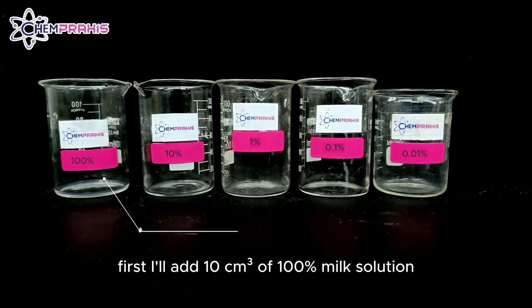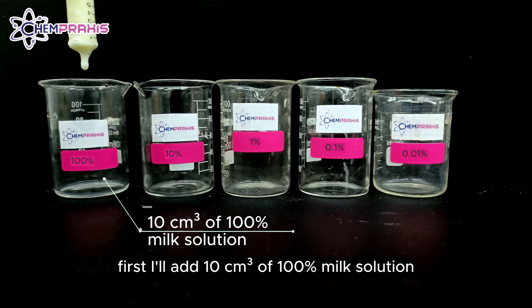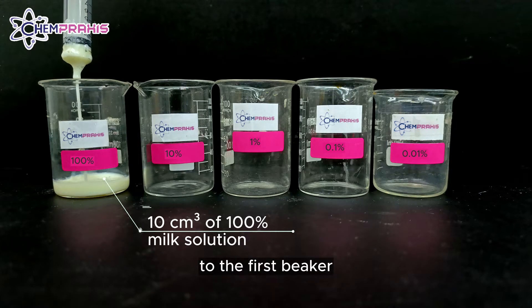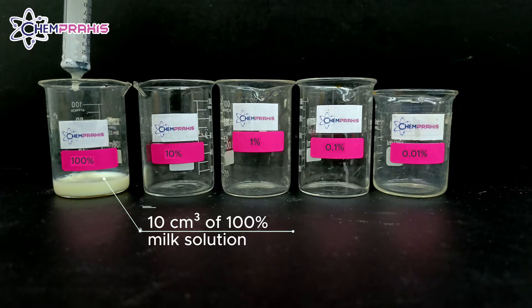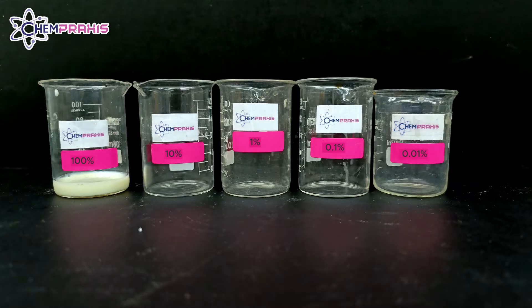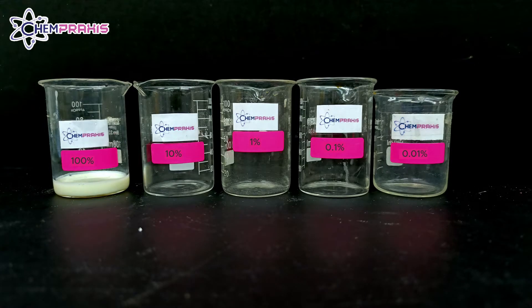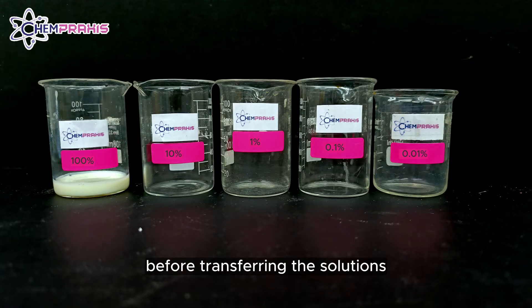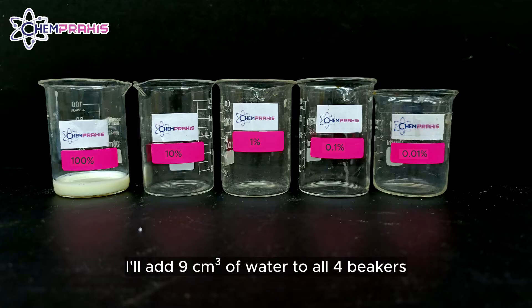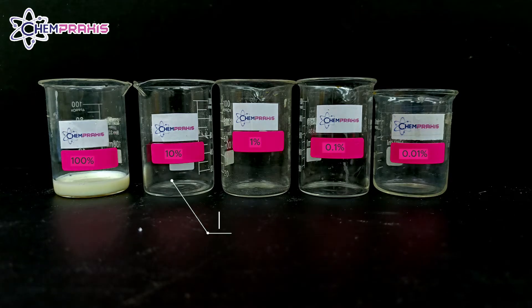First, I'll add 10 cm³ of 100% milk solution to the first beaker. Before transferring the solution, I'll add 9 cm³ of water to all 4 beakers.